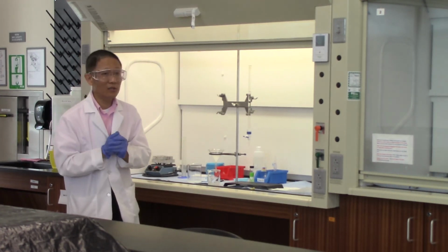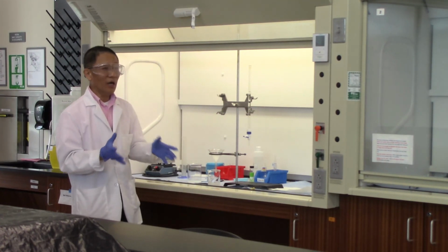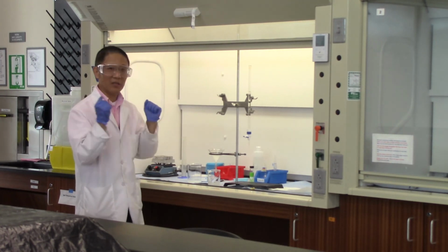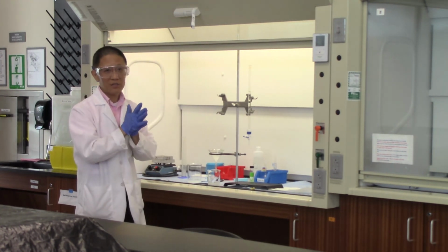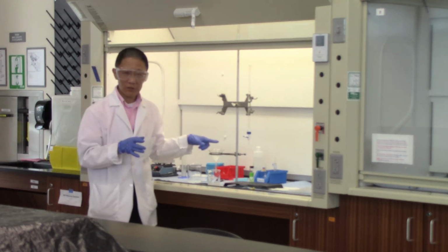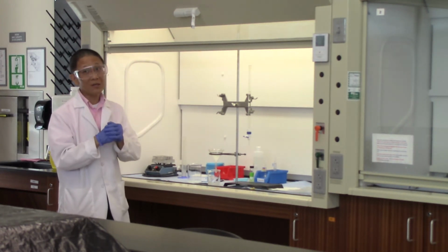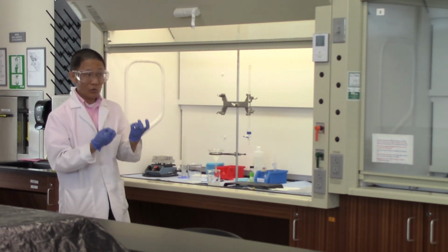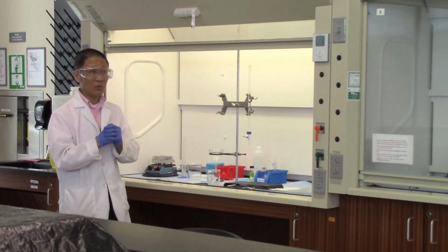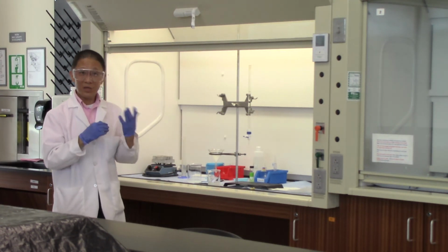The last thing that we need to do is clean up. You now have all the used chemicals and different solutions. There is a waste station in your lab, and we just need to take everything there and dump it into the waste container. Since the sample is still wet when you finish the filtration, we're going to leave it in your drawer and let it dry over the week. Next time you come back here, we will measure the mass.